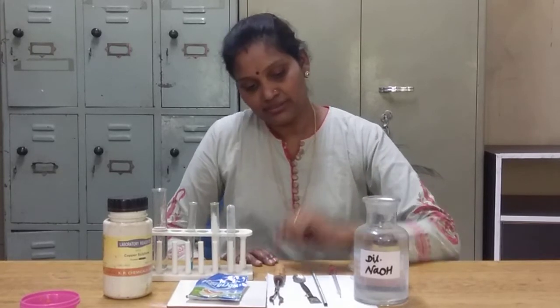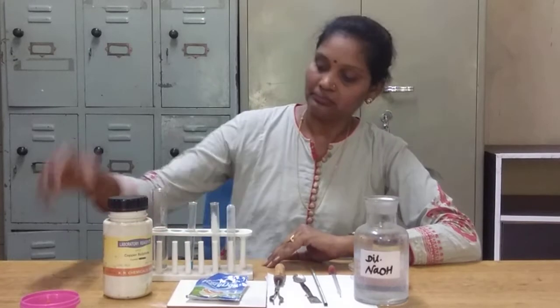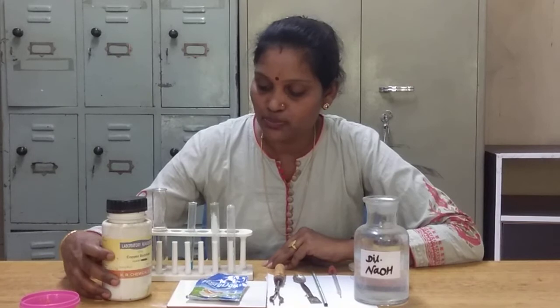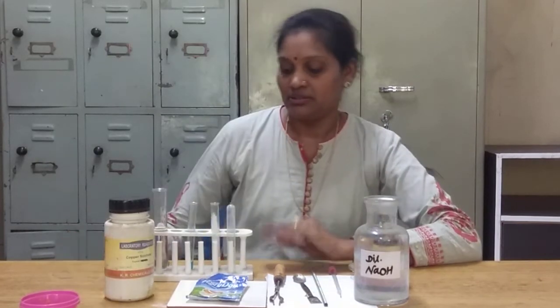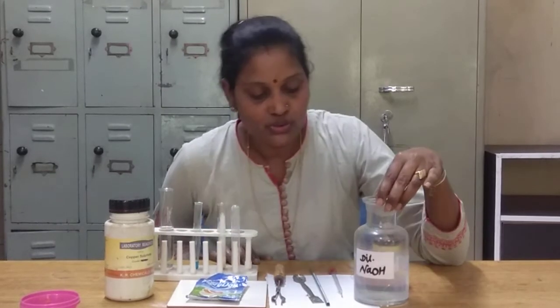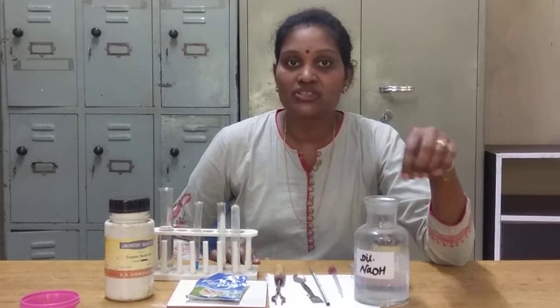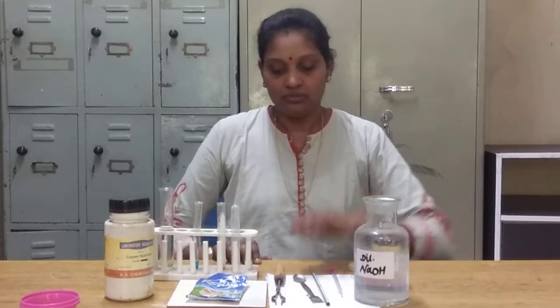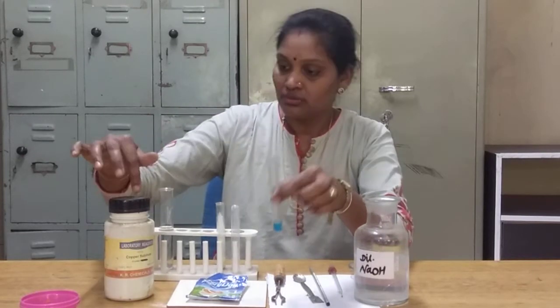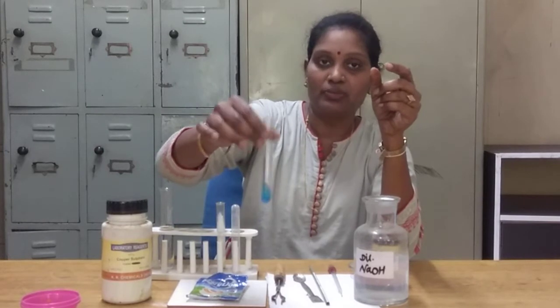For the presence of proteins, these are the items which are required. First of all, this is the copper sulphate — crystal copper sulphate. This is the test tube stand. This is the dilute sodium hydroxide, which is also caustic soda mixed with water. Now I have prepared the copper sulphate solution — copper sulphate and water.